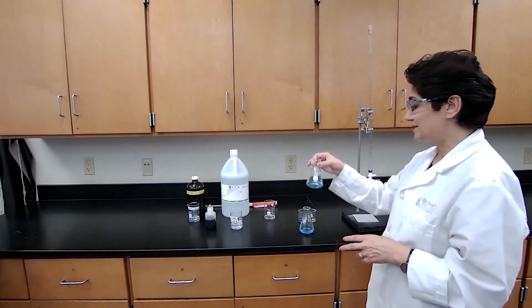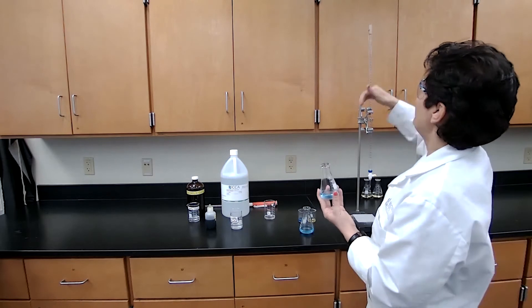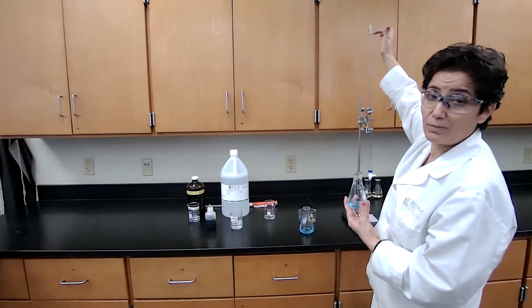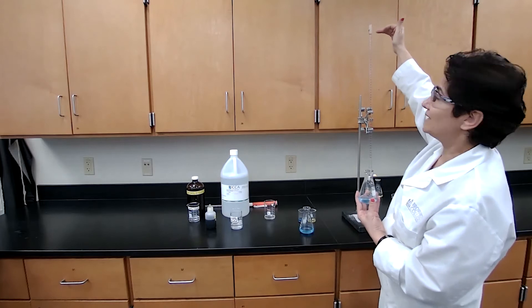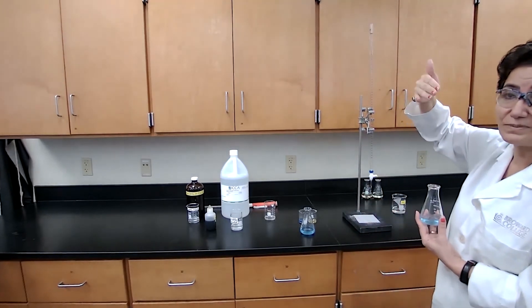Now we are doing the second part of the experiment, starting second part of the experiment. I have refilled the burette to 0.00 again. So we have the initial reading. This is for part two, part B of the experiment.